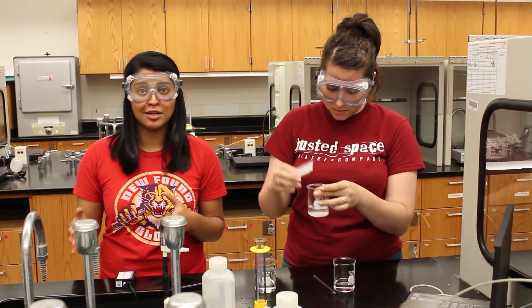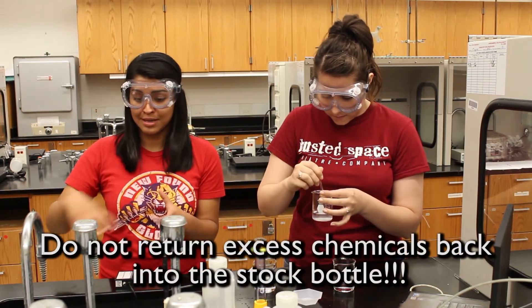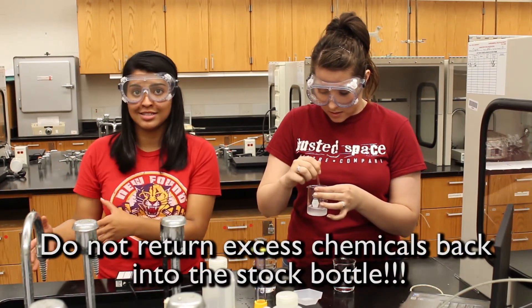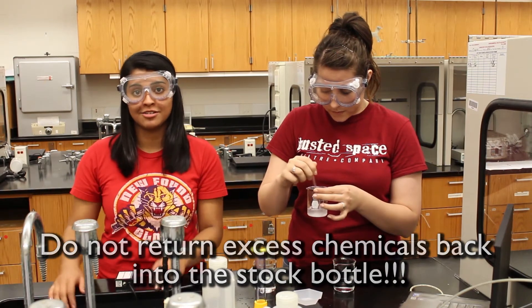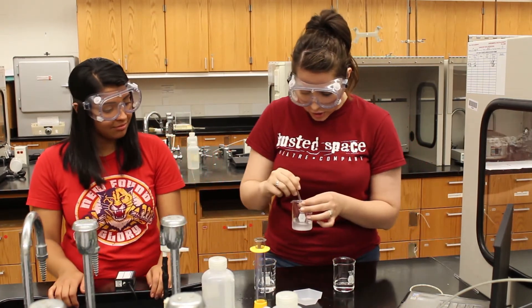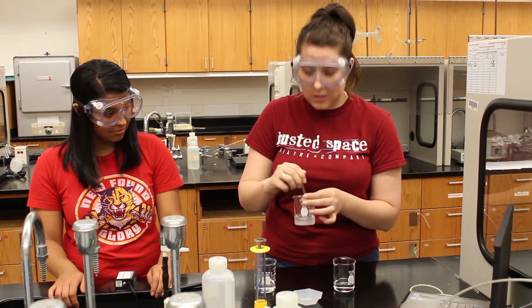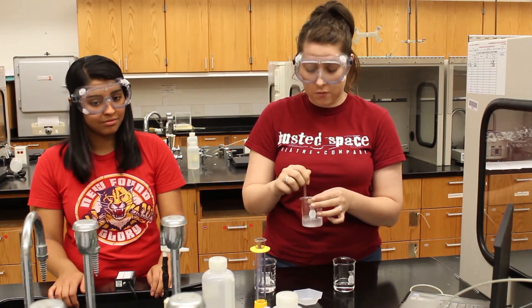It's okay if you accidentally pour too much sample out, but make sure you never put that sample back into the stock container. Place the excess into the waste container. Once you add your sodium chloride to the water, you'll want to make sure you stir until the solid completely dissolves into the water.